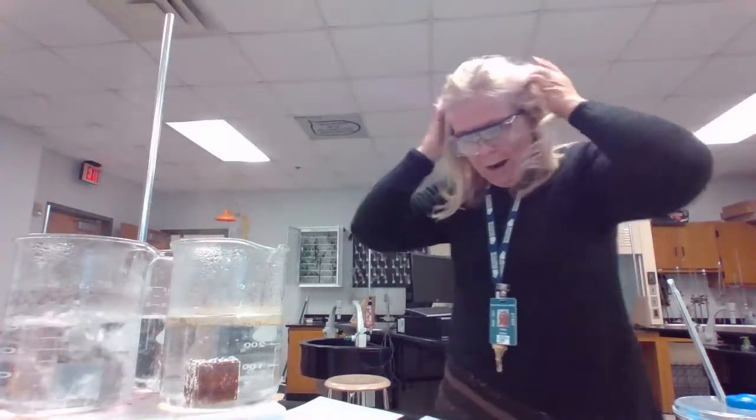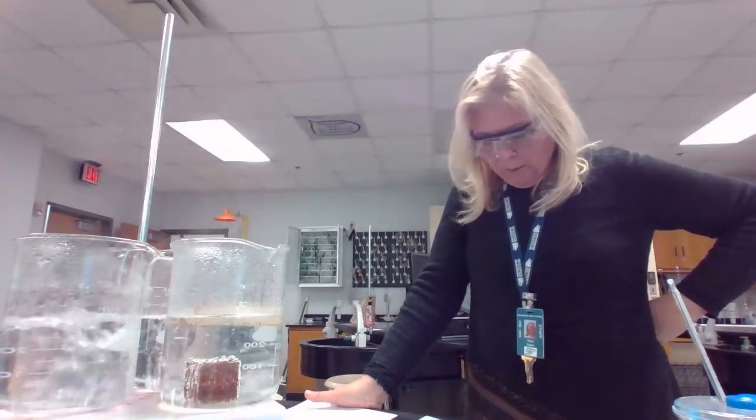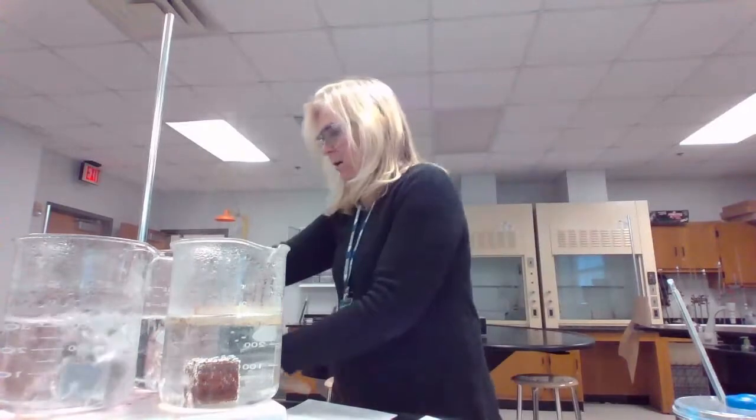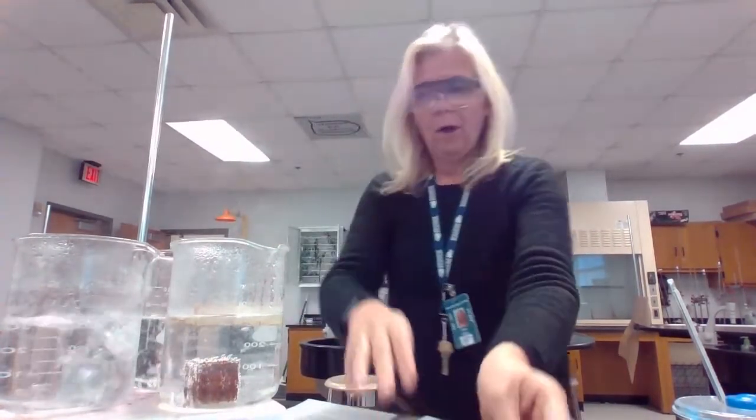Okay, so while they're heating, you're making a data table, and we're going to do this for 3 different metals, pretty much at the same time, so that we can record all this data at the same time. What we want to do is remove the metal from the hot water and dab it off on a paper towel. So I'm getting some paper towel here so that we don't take any hot water with us into the calorimeter. We don't want to add any hot water.